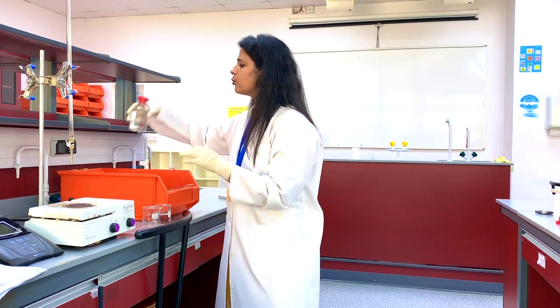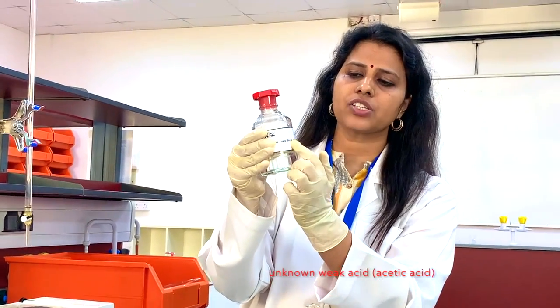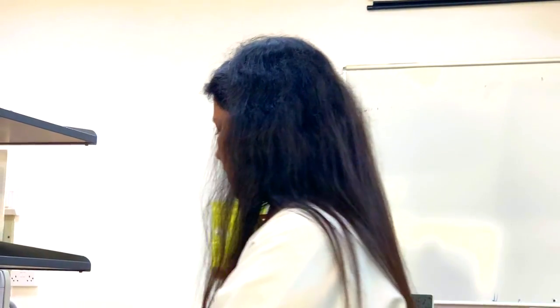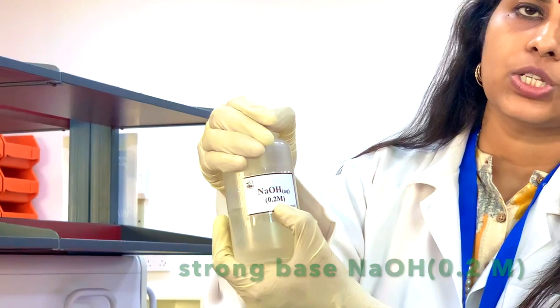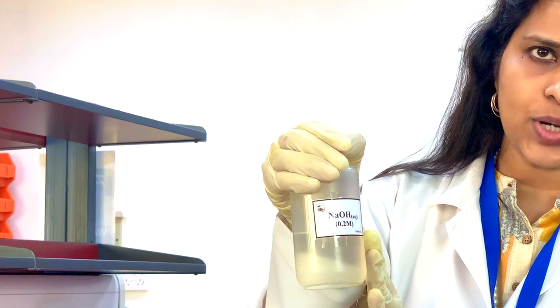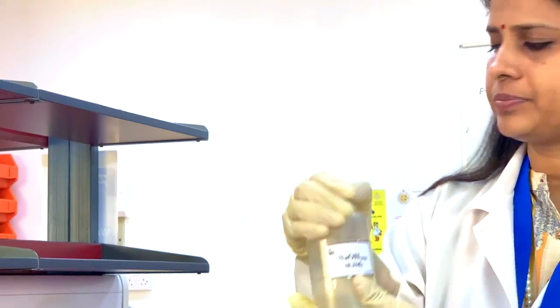For this experiment, we need a weak acid and a strong base. In today's experiment, I'm going to use acetic acid as the weak acid, whose concentration is unknown. We need the base NaOH, whose concentration is 0.2 molar. This is a strong base. This is the titrant because we know the concentration, 0.2 molar.